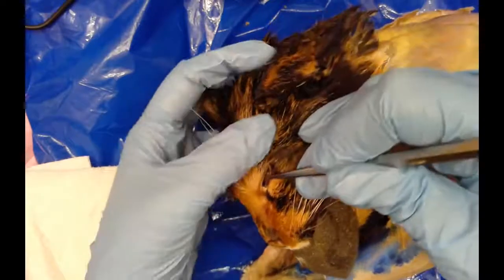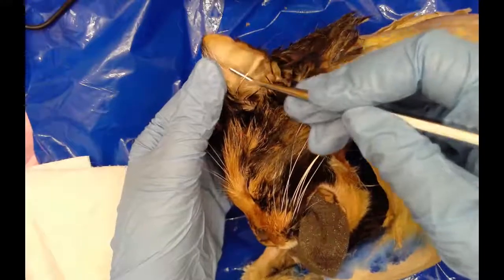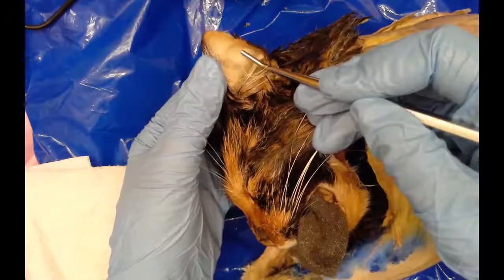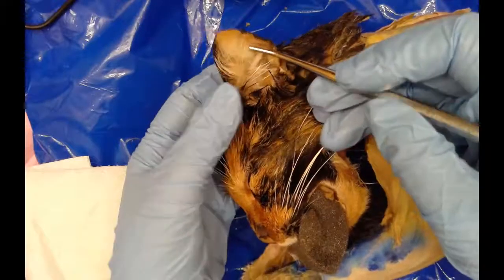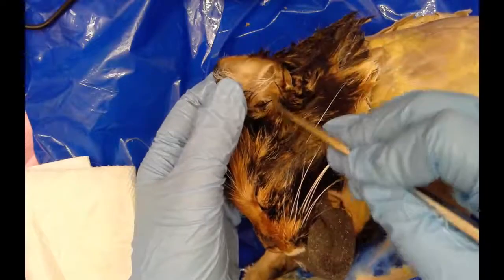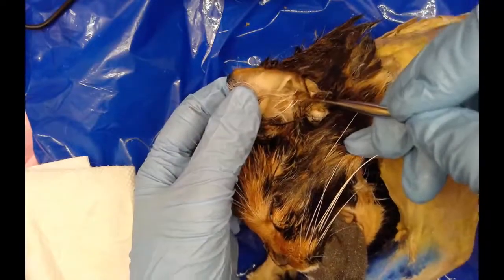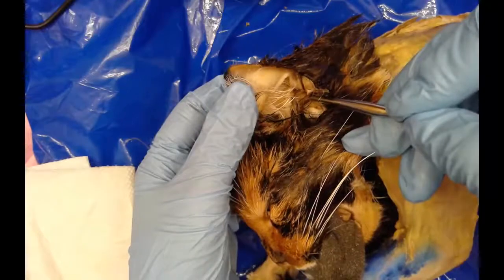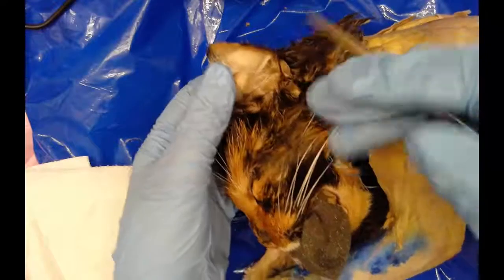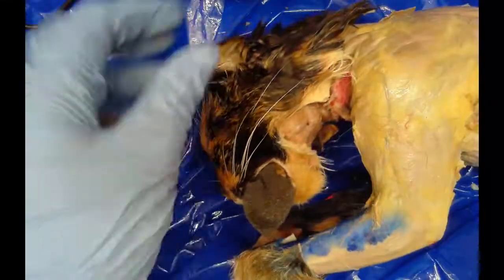Moving further back, I have this big ear flap here. This is called the pinna, P-I-N-N-A. And if I look down into where the pinna leads, it leads into this little ear canal called the external auditory meatus. And that's all we want to focus on in the head region for right now.